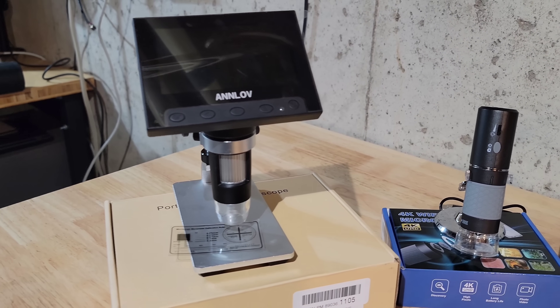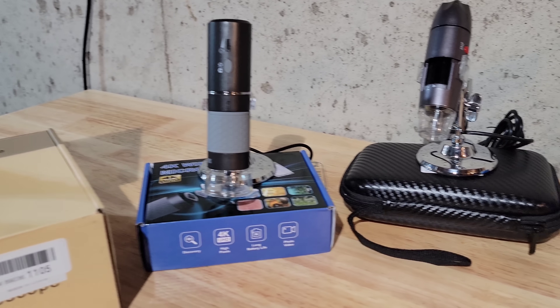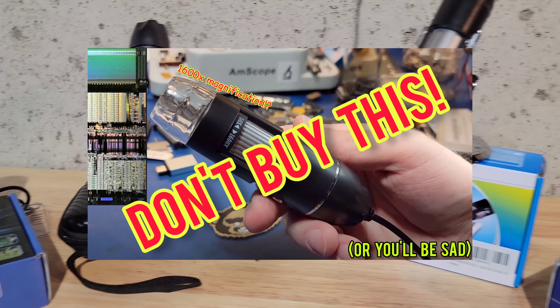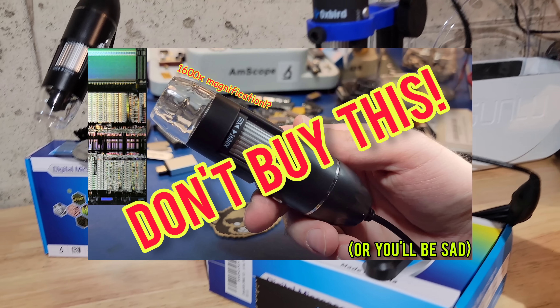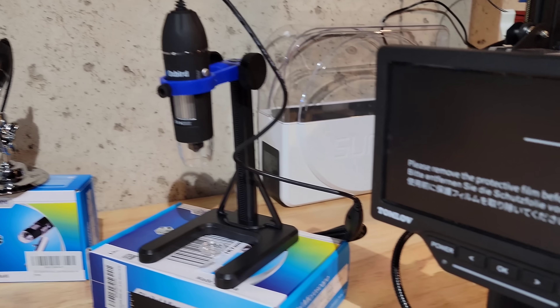Hello and welcome to a follow-up video to my previous comparison video on digital microscopes. There are a few aspects of that video that I'd like to elaborate on.